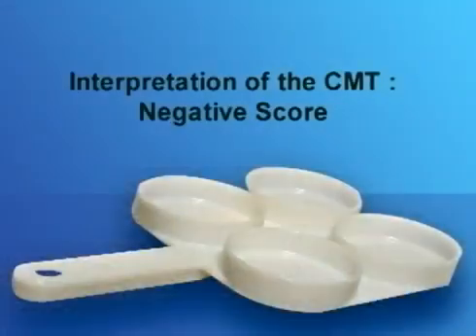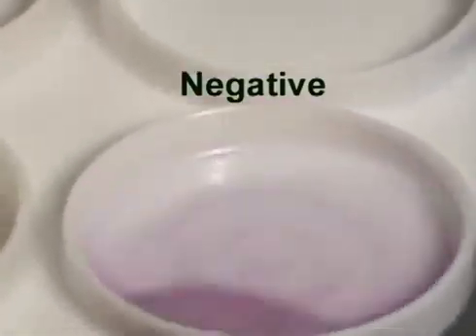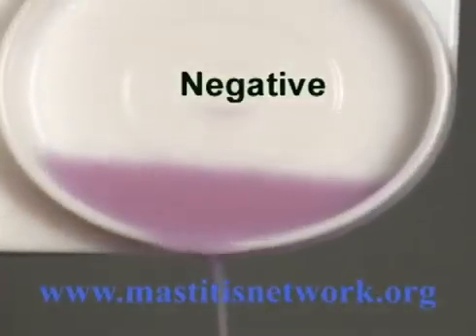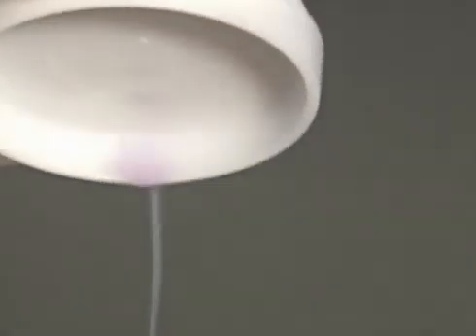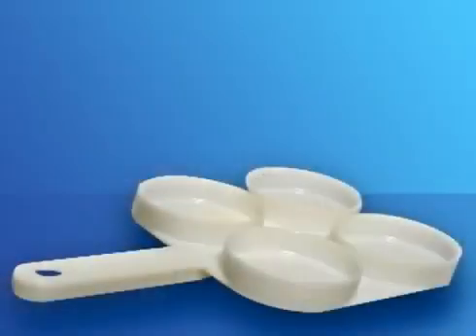Let's start the interpretation by the negative reaction. Here, the cup contains healthy milk. The mixture remains liquid and homogeneous. When pouring out the paddle, the mixture drips out normally. It should be noted that a trace reaction is often difficult to distinguish from a negative reaction. This is why it will not be shown in this video.